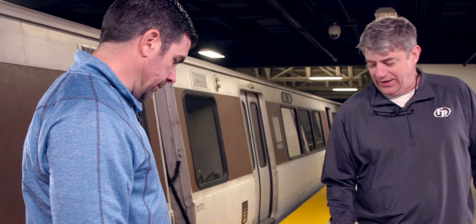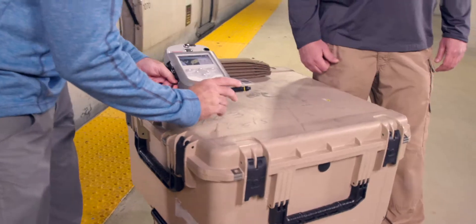Alan Higgins here again with Dave. What we're going to do now is we're going to show you how small of a sample this thing can actually identify. What we have here is larger than you actually need. All you need is a single crystal.